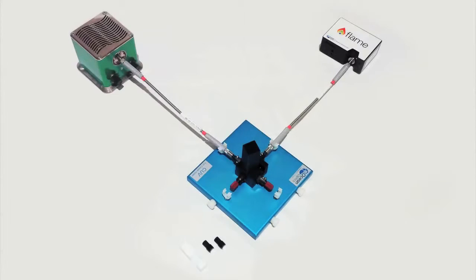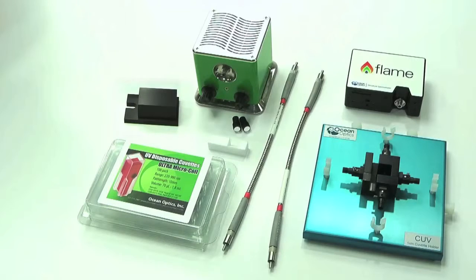In this video we will demonstrate how OceanOptics products can be used to perform a fluorescence measurement. We will use products available in our fluorescence bundle.